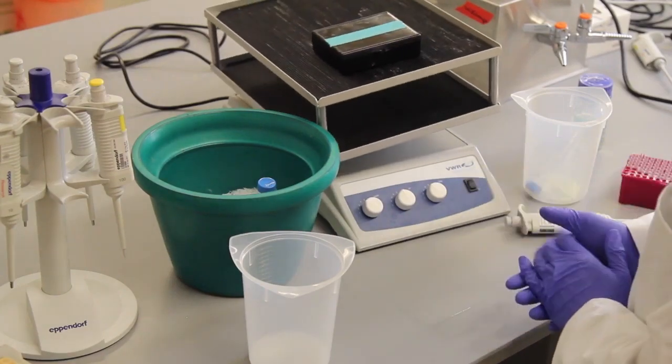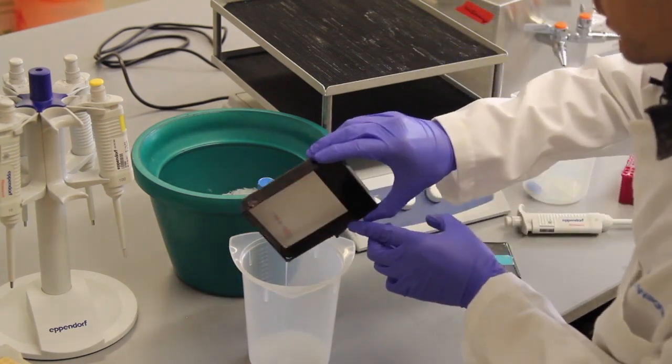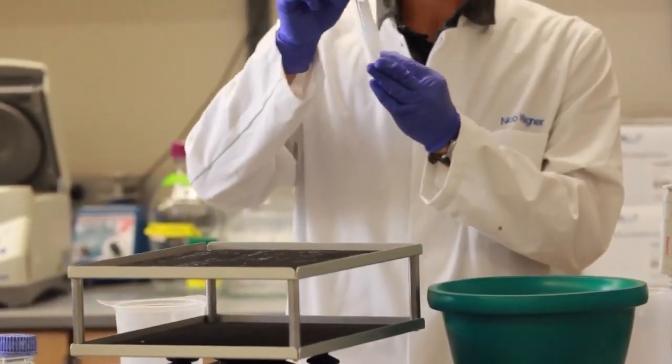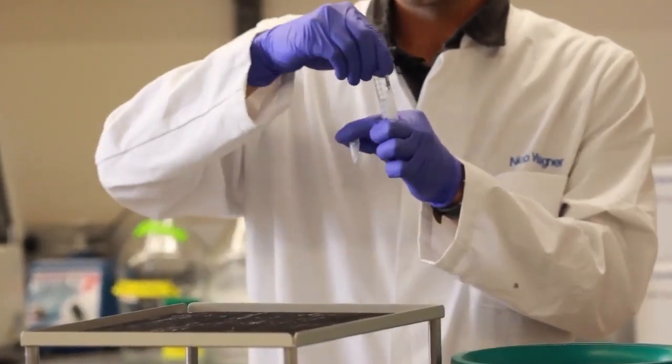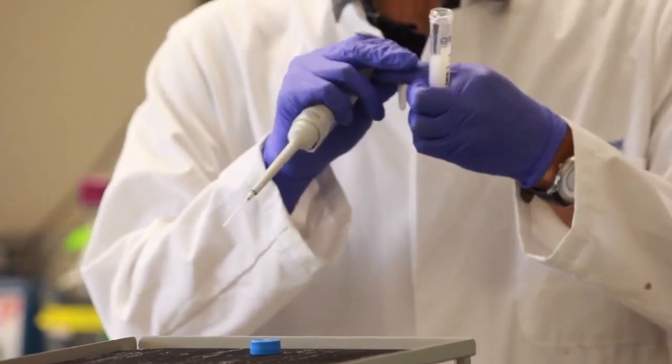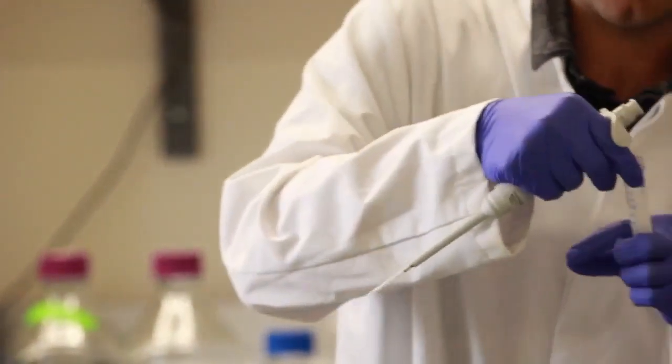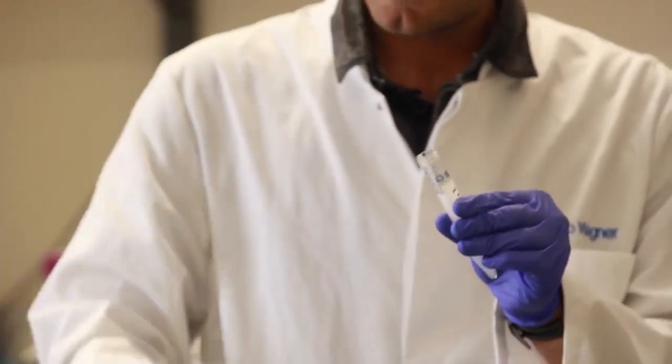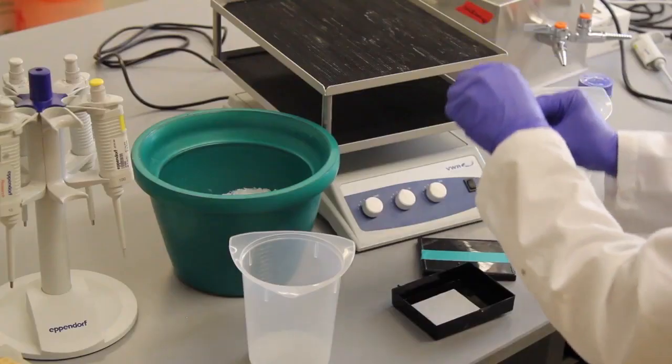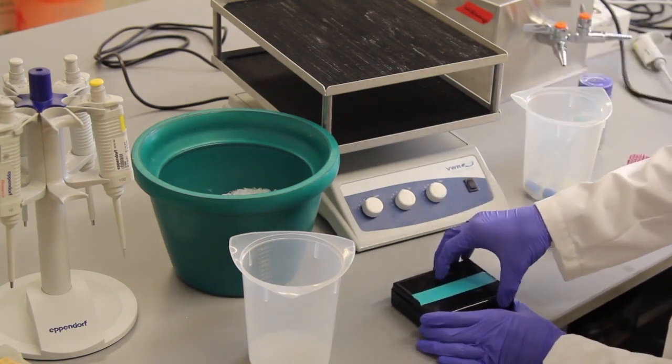The third wash is now complete, which means you take the membrane off one more time. As before, dump the liquid into the liquid waste. And now it's time to add the secondary antibody. This, like the primary antibody, gets added into a milk solution. However, the secondary antibody is only required at a dilution of one to 10,000, which means in the 10 milliliters, I add one microliter of antibody. Pipette it into here. Quickly invert it to make sure it's mixed. Just add on top of the membrane. And place back on the rocker for about one hour.